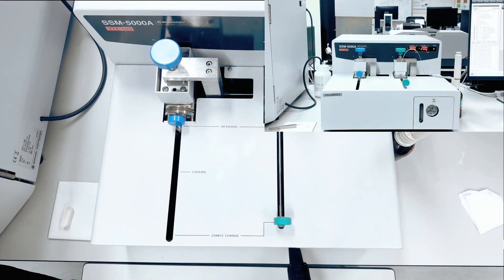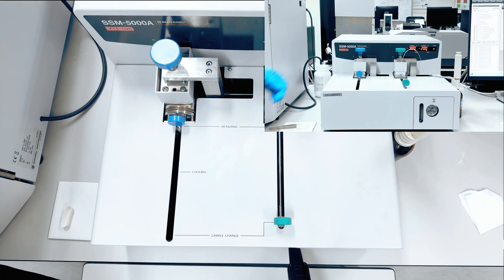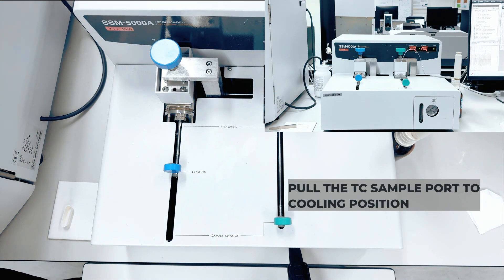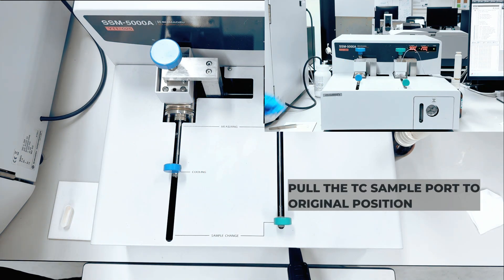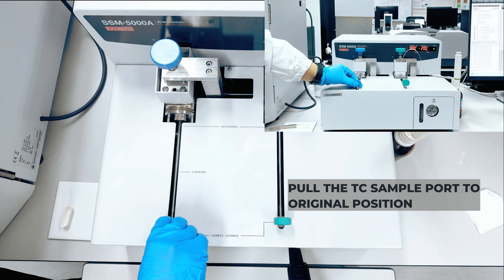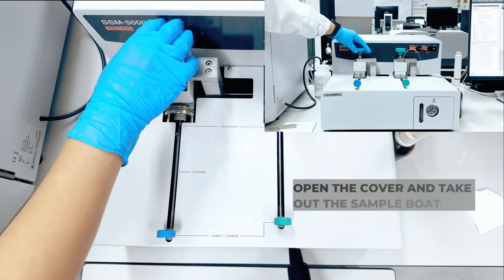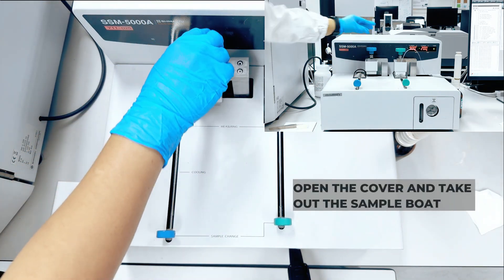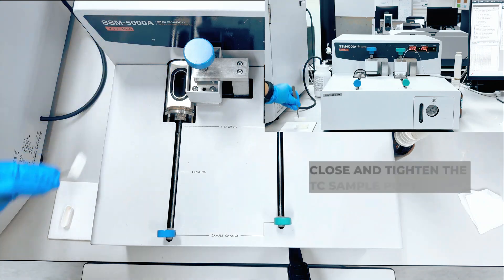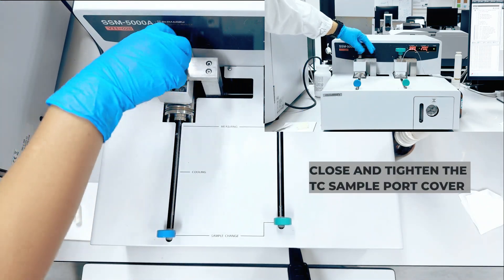After the measurement, follow the instructions in the window by pulling the port to the cooling position, followed by the original sample change position. Lastly, take out the sample, then close and tighten the cover.